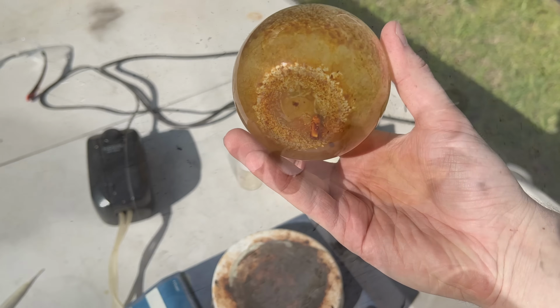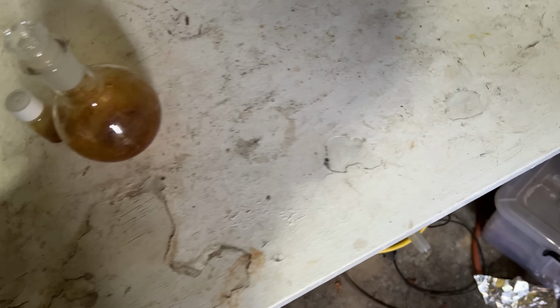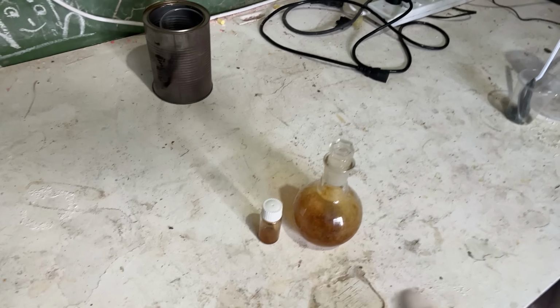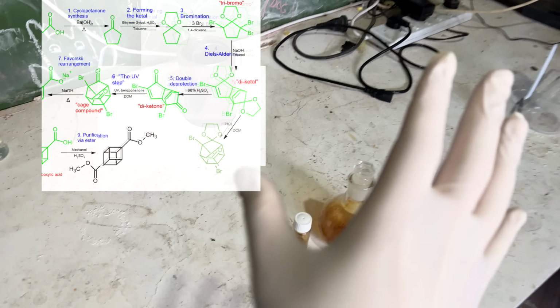We are with our bloody cubane, disgusting tar. Maybe not this DCM. Yeah, we've disregarded these DCM extracts. So here we are. It's probably all up about 3/4 of a gram, so not a whole lot. And we know it's very impure. We can look at the analysis. It's all very impure. So the next step is to turn this cubane diacid into the methyl ester.